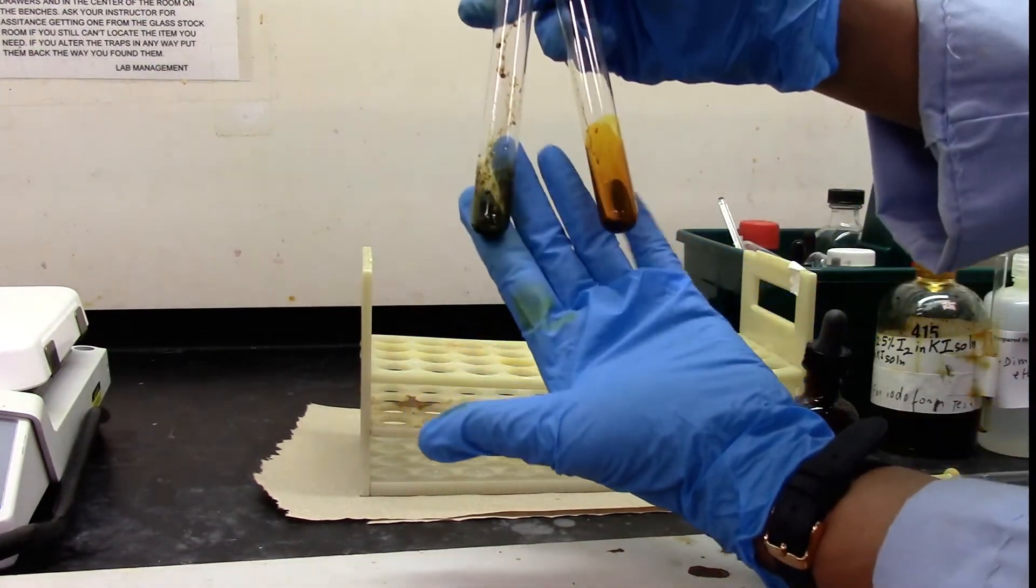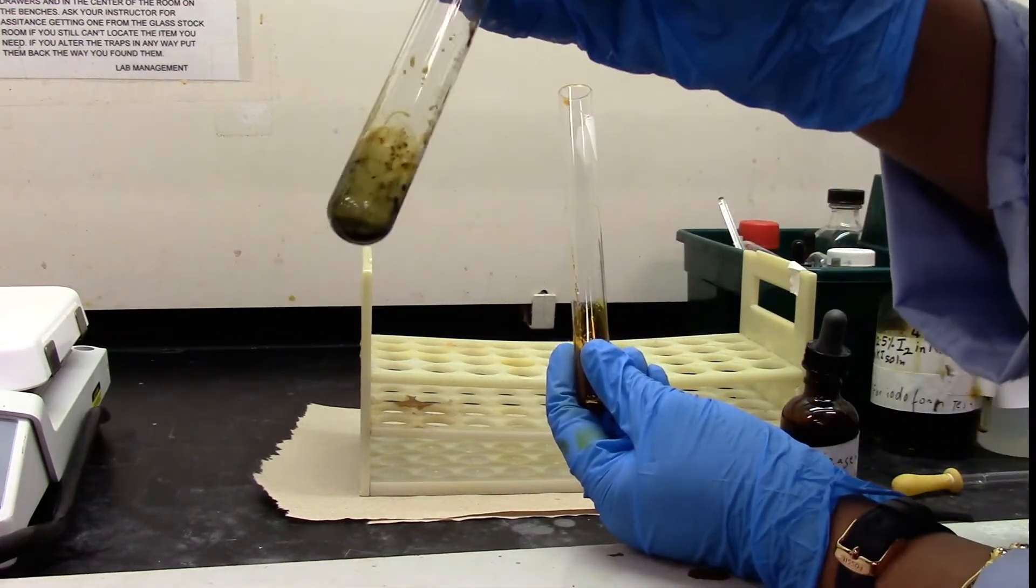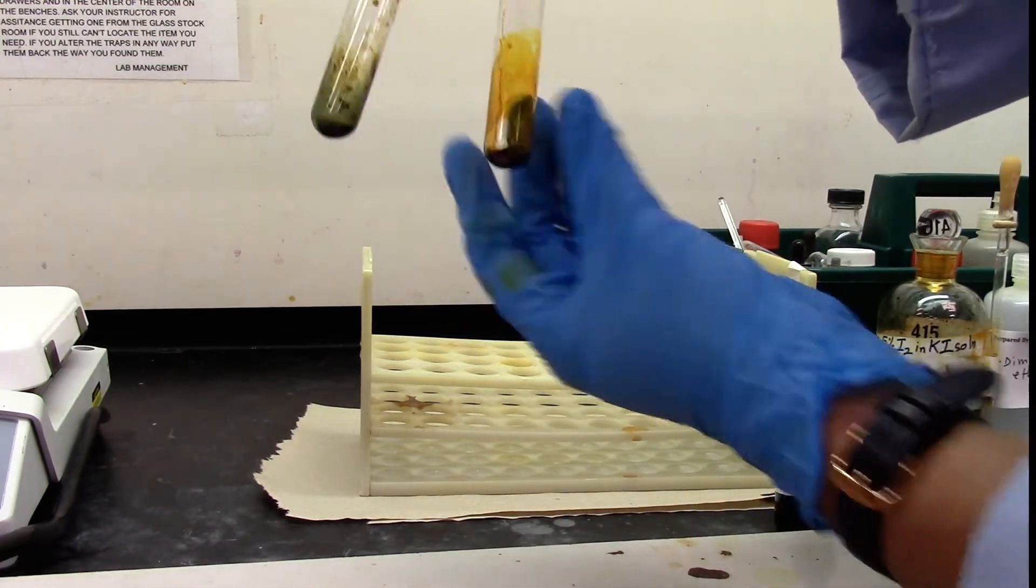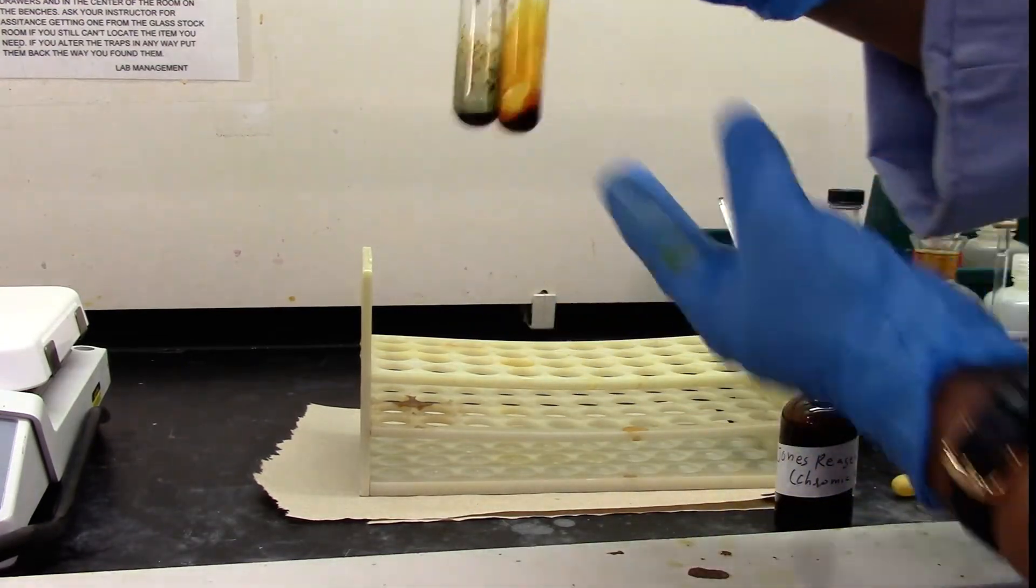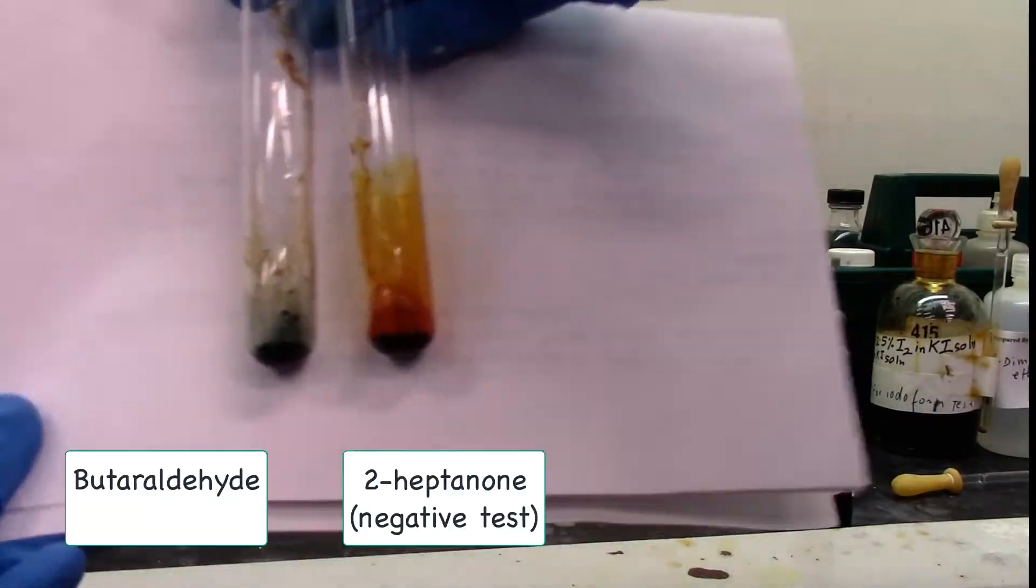I will do the same with the negative test. This definitely feels warm, and as you can see it's turning gradually to a greenish color. The negative test is still red-yellow. I will place a white background to show you the color.